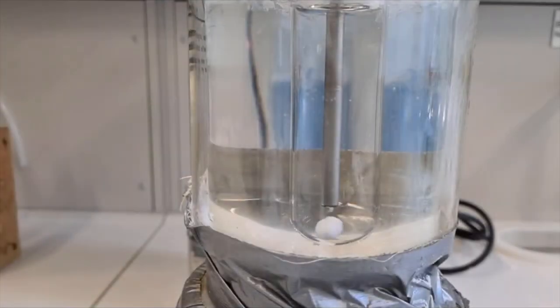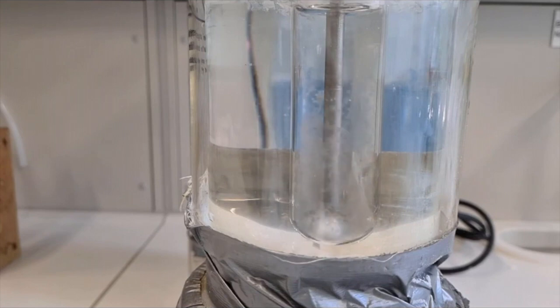The crystallization of the solution can be detected not only with the recorder, but also seen with the naked eye.